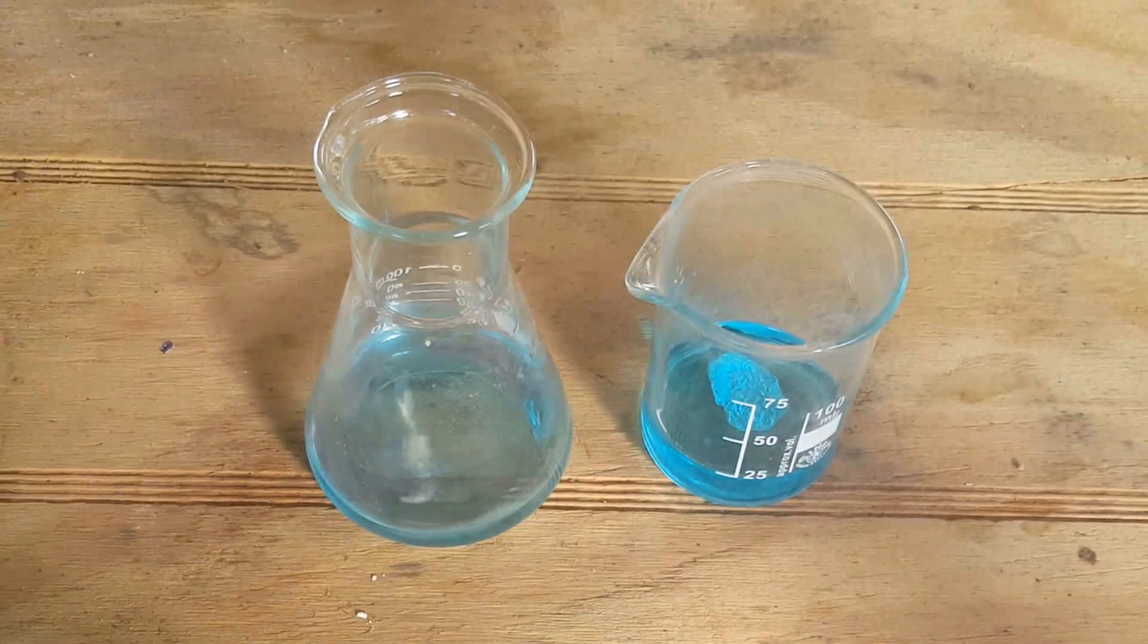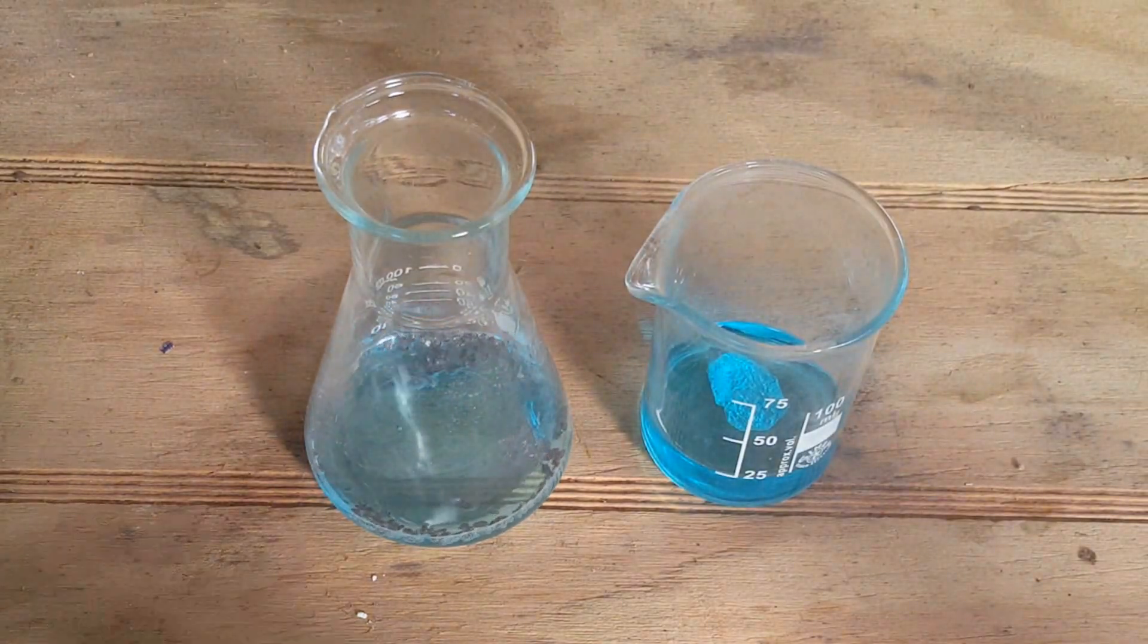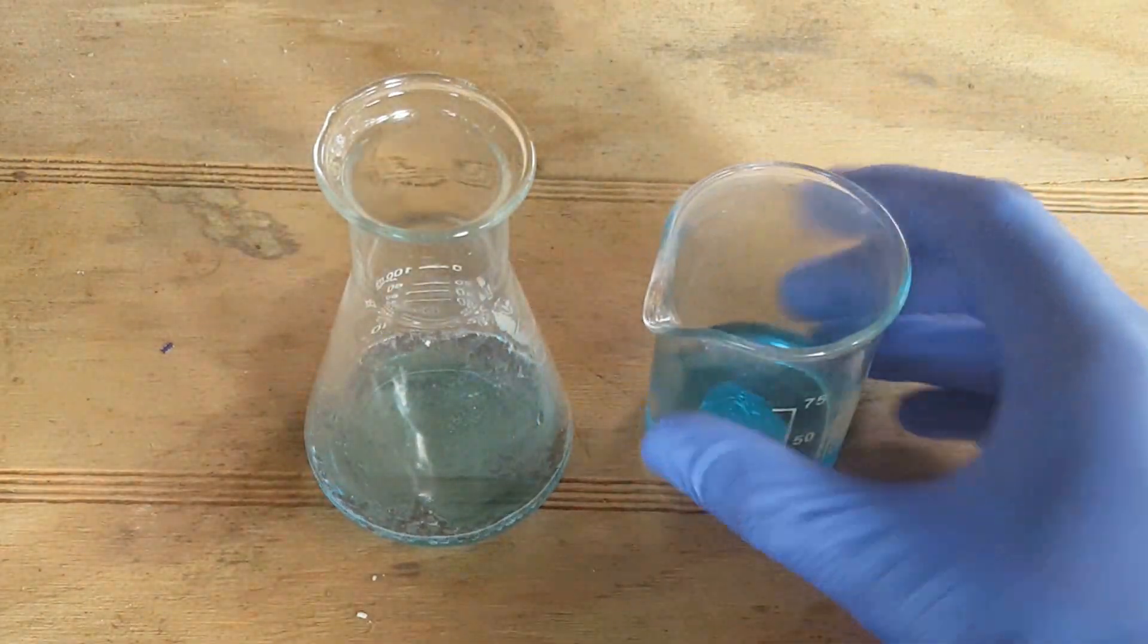This is a time-lapse of the two experiments. The aluminum seems to react very slowly with the copper sulfate.